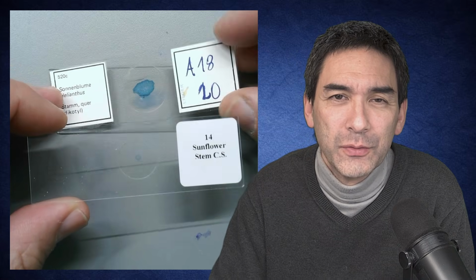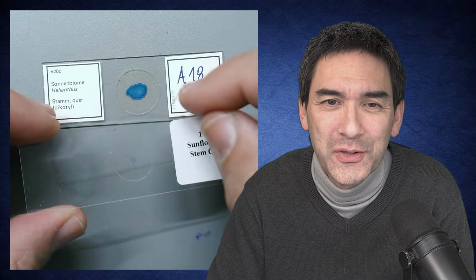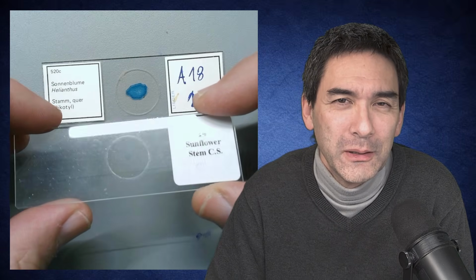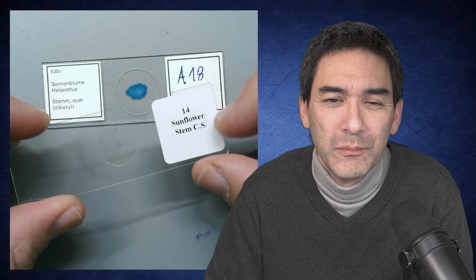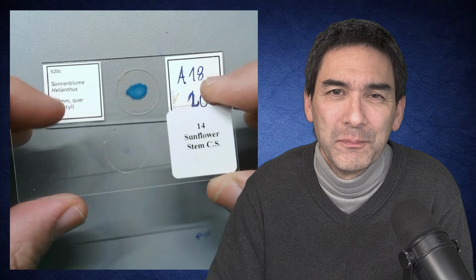You can already see from the outside that not only is the size different, but also the stain intensity, the color intensity is different. So let's put them under the microscope and compare how those slides differ in their quality. I'm going to start with the cheap one first, the one where the stem is quite small here. So let's have a look.